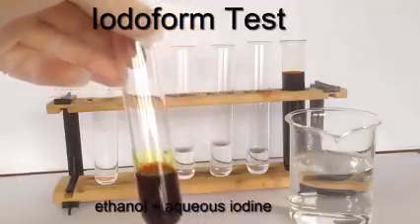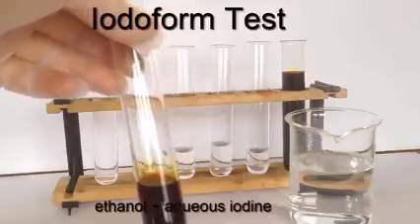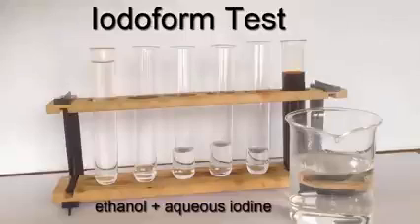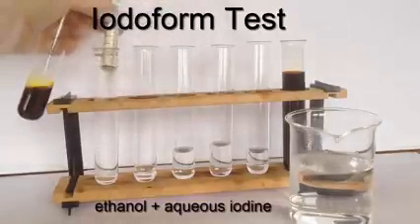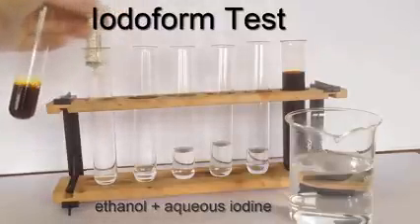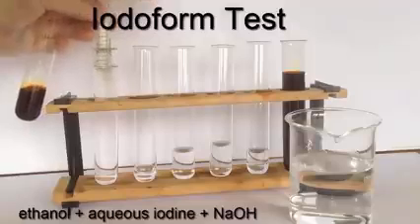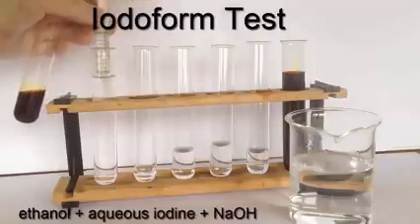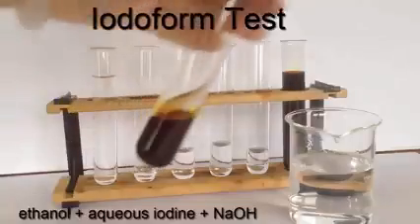And what the procedure requires me to do here is to add the 2 molar aqueous sodium hydroxide in a slow dropwise fashion. I'm using a small syringe here for convenience. And I keep adding the sodium hydroxide until the brown color of the iodine disappears, or just disappears.